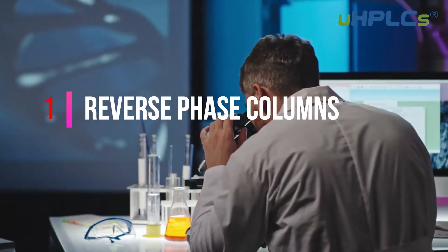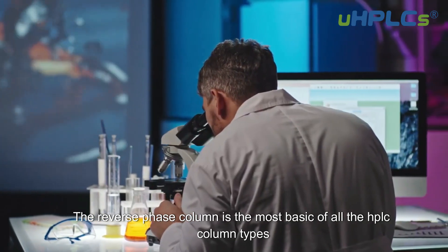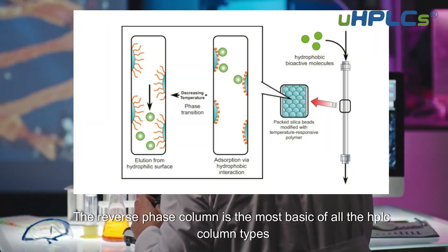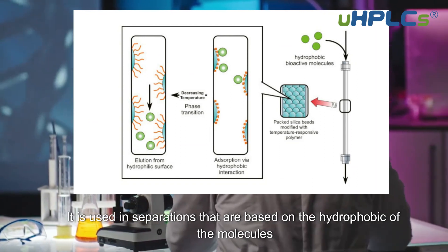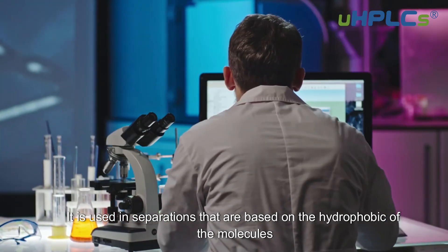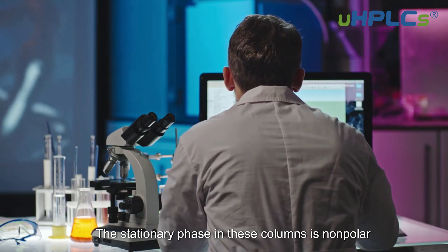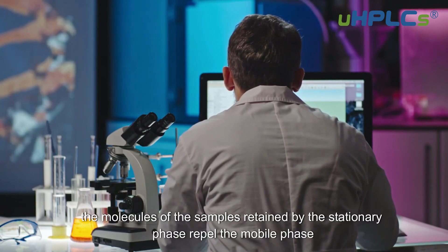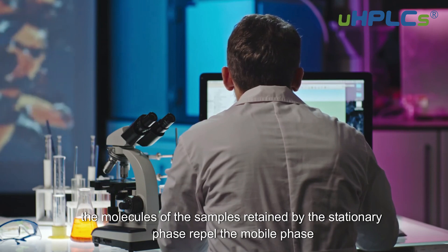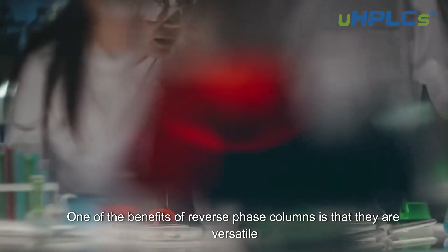Reverse Phase Columns. The reverse phase column is the most basic of all the HPLC column types. It is used in separations that are based on the hydrophobicity of the molecules. The stationary phase in these columns is nonpolar, and the mobile phase is polar. The molecules of the samples retained by the stationary phase repel the mobile phase.